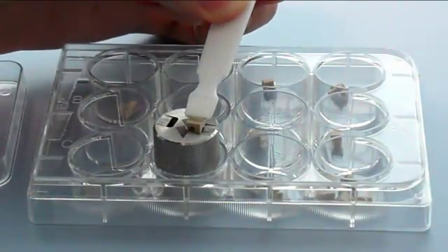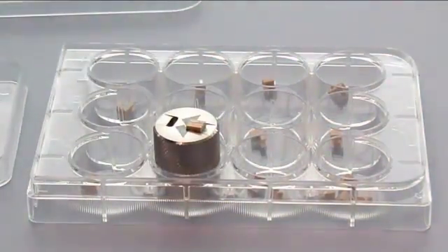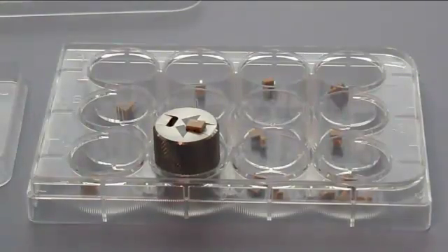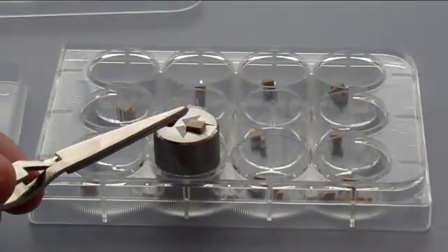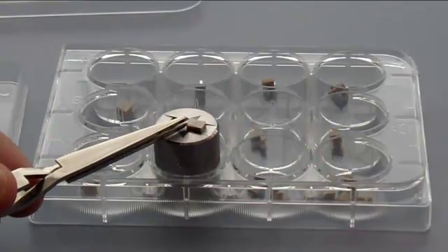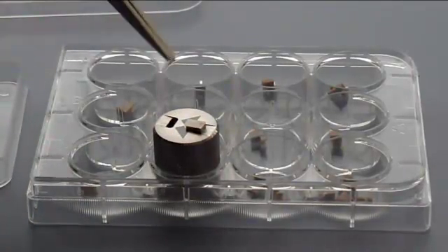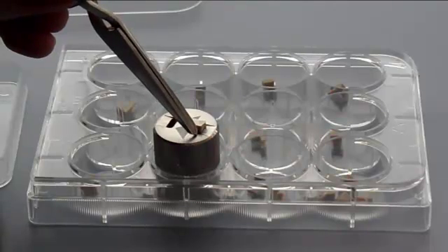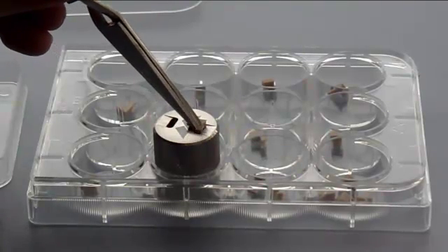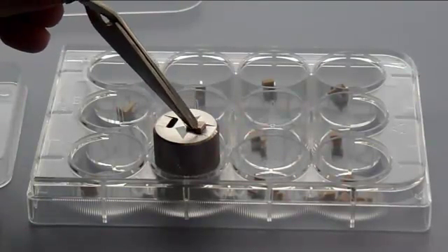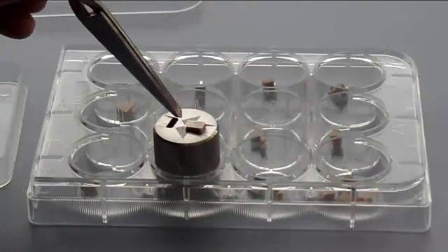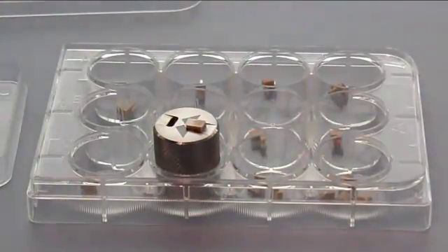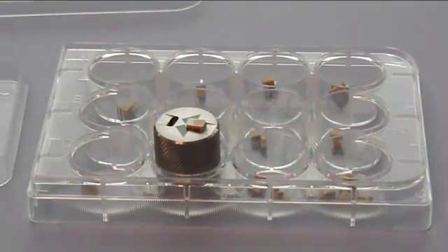Once the sample has been cut to size, it is attached to the sample holder on the gluing tool. In this case, the polymer is to be glued to the sample holder using the glue araldite. A small amount of the glue is pasted onto the sample holder. The sample is rested on top of the glue, with the side to be tested facing upwards and away from the sample holder. Make sure to position the sample so that it is square with the holder and well attached to the surface.